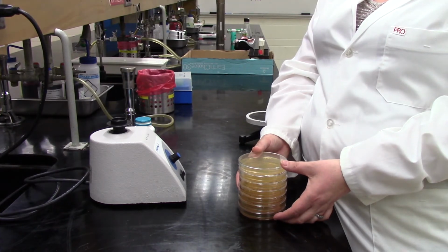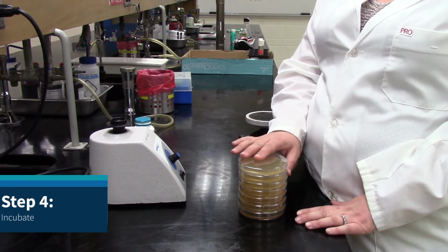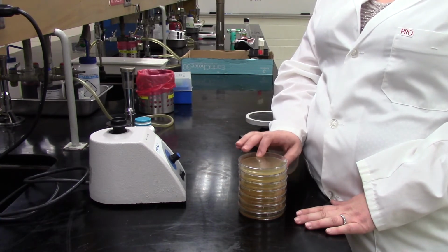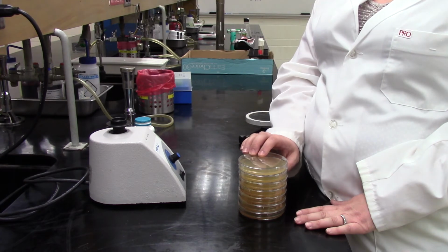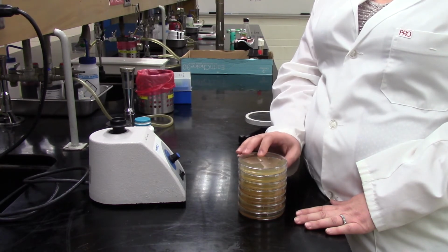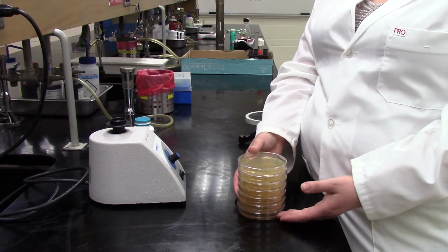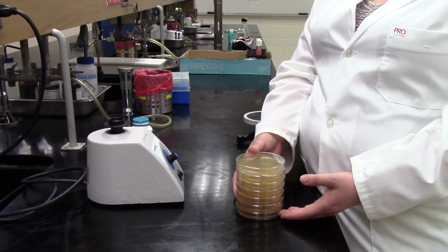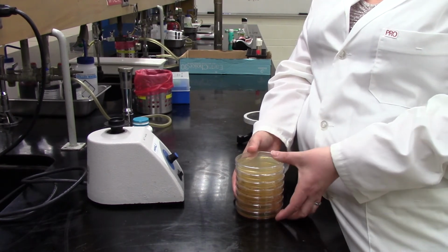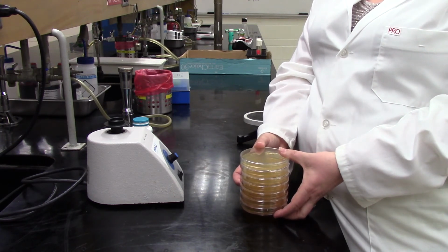All right, hi again, everyone. We just wanted to show you guys the end steps for enumerating lactobacilli in probiotic cultures. So we've done all of our spread plates now. We didn't bore you with the whole series of repetitiveness of doing all the spread plates, but they're done now. You can see them in a stack there. Sabrina has them. They are going to go into the incubator for 48 hours at 30 degrees Celsius.